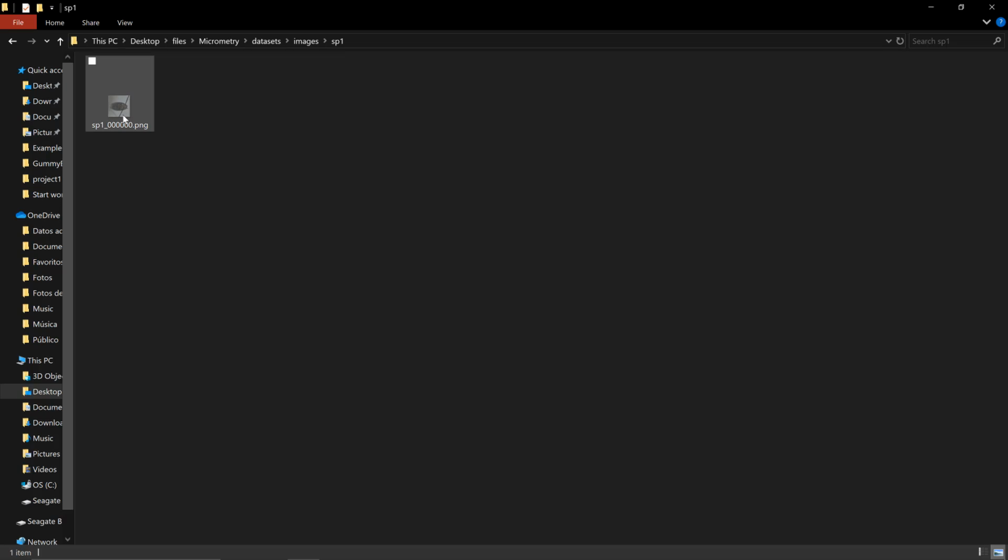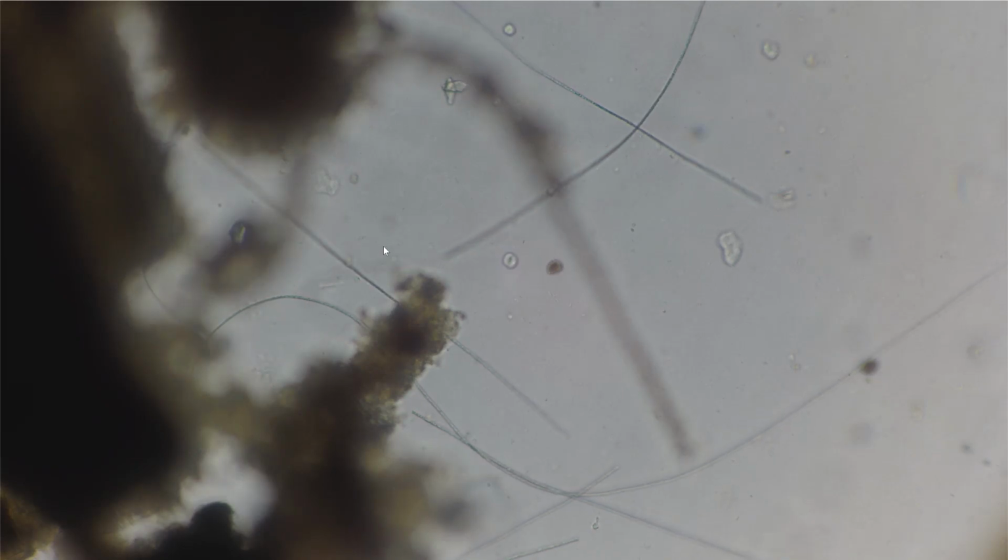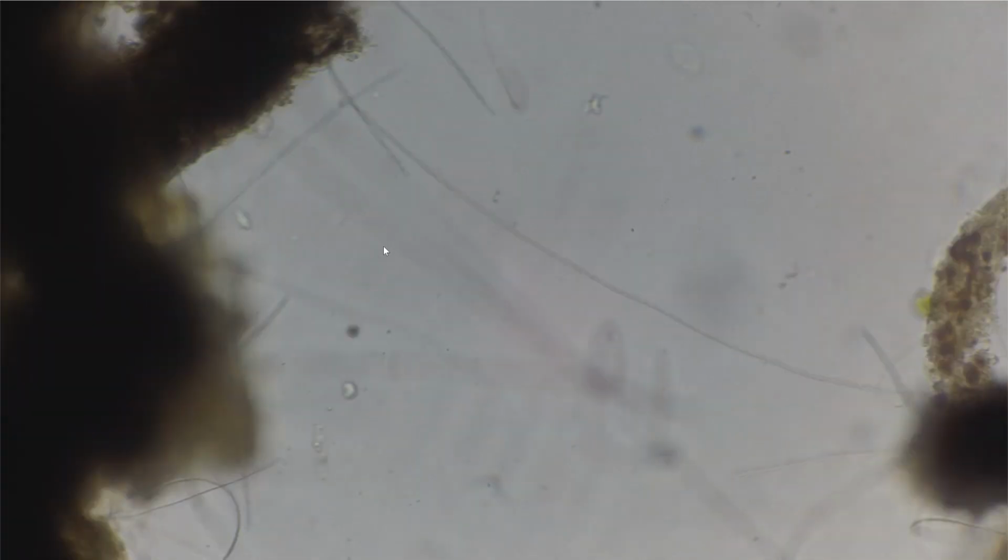Notice that there is room for a lot of samples, and every sample that you create is going to have its number updated here out of 6 digits sequentially. So you have enough room to take millions of photographs of specimens. If I want to go back now to live mode, I can press spacebar again, and that is going to take me back to the original view. And that's pretty much it.